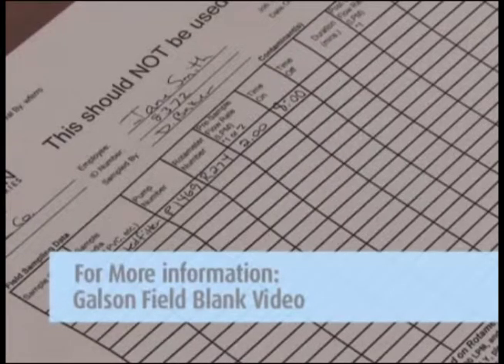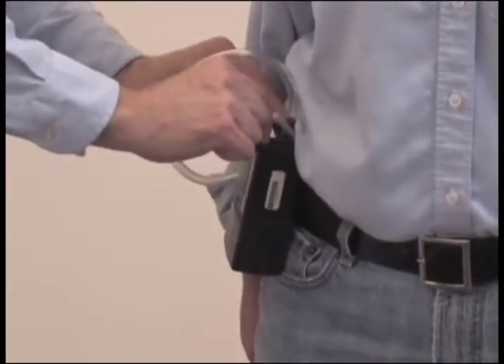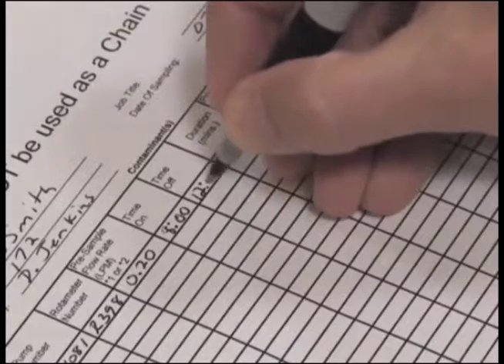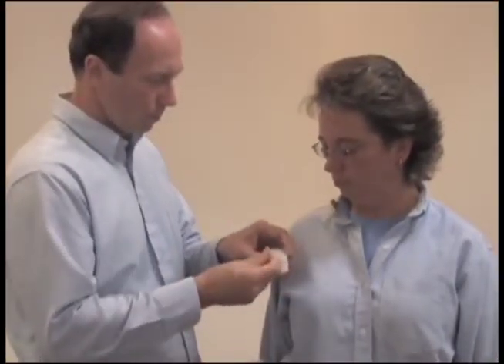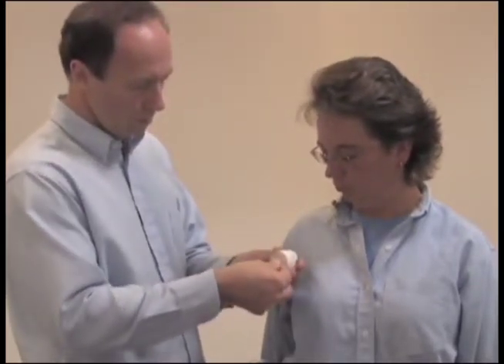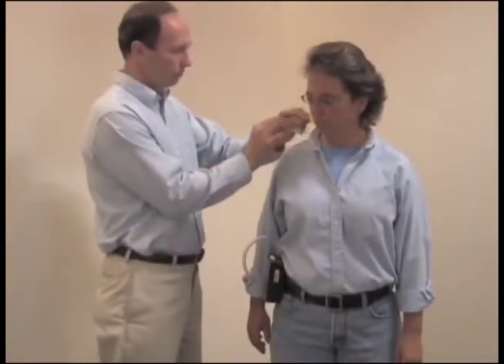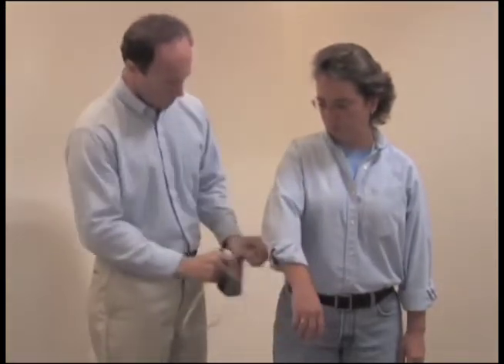For more detailed information, watch our field blanks video. After sampling is complete, turn off the pump and record the time. Remove the filter cassette and reinstall the colored nibs on both sides. Remove the equipment and return to the area where you performed the pre-calibration to perform post-calibration and prepare your sample for shipment.